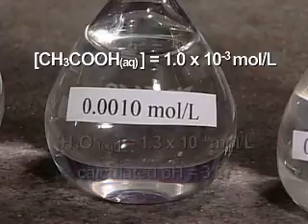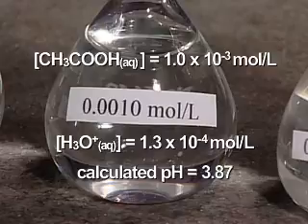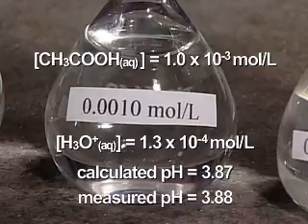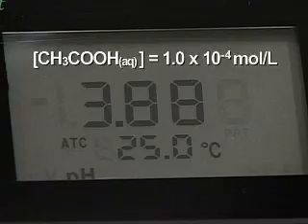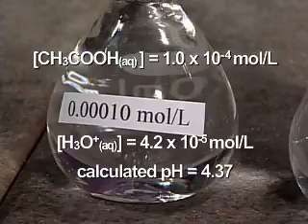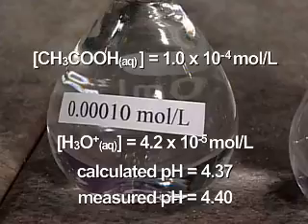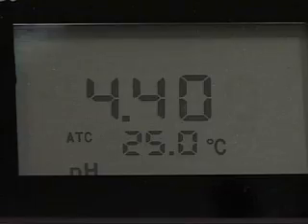0.0010 mole per liter ethanoic acid is 13.0% ionized and the hydronium ion concentration is 1.3 times 10 to the negative 4 mole per liter. The measured pH is 3.88. 0.00010 mole per liter ethanoic acid is 42.4% ionized and the hydronium ion concentration is 4.2 times 10 to the negative 5 mole per liter. The measured pH is 4.40.